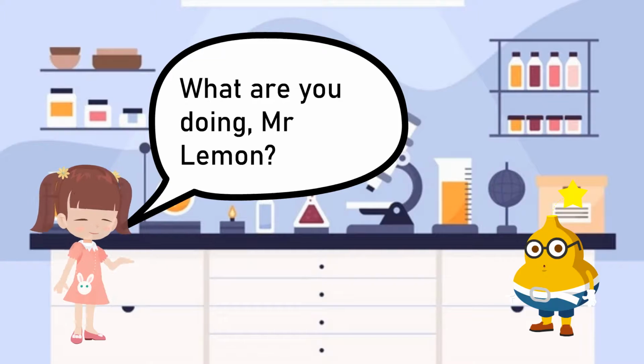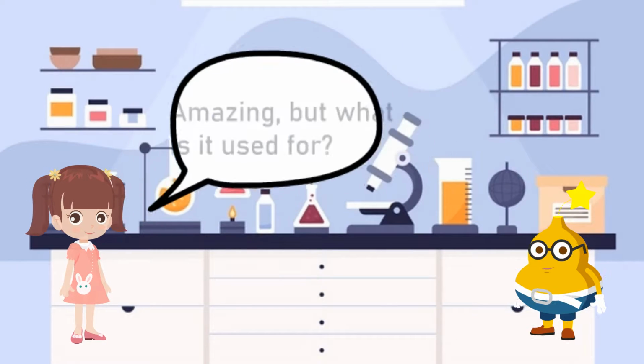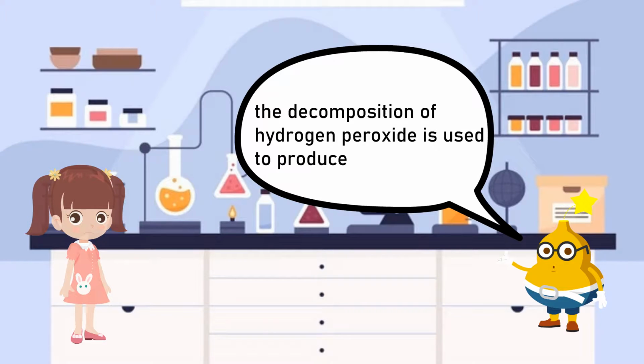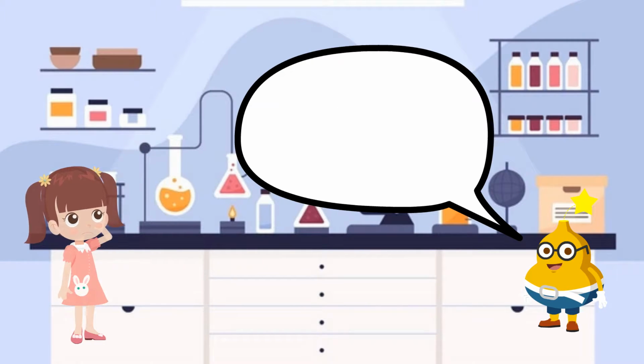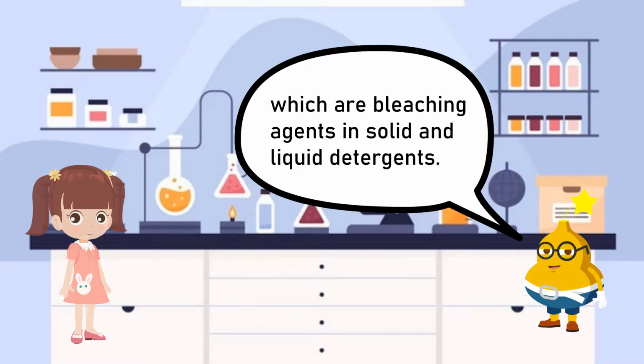What are you doing, Mr. Lemon? As you can see, I am doing the experiment of decomposition of hydrogen peroxide. Amazing, but what is it used for? Well, in many industries, the decomposition of hydrogen peroxide is used to produce sodium perborate and sodium percarbonate, which are bleaching agents in solid and liquid detergents.